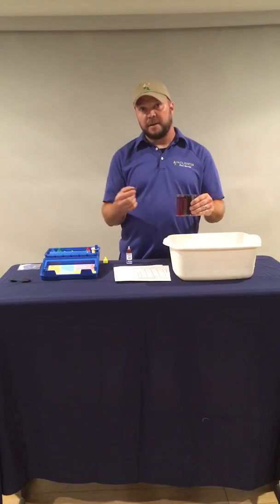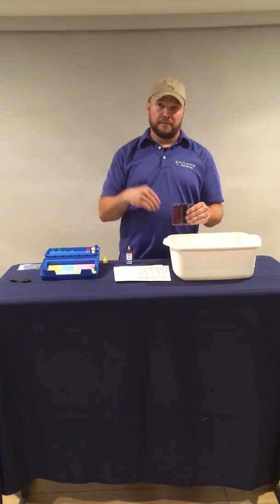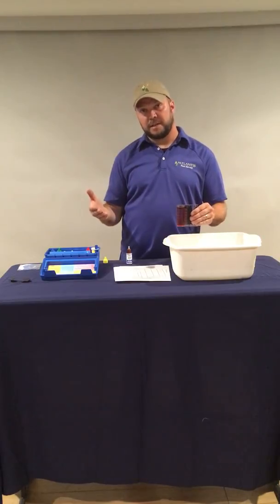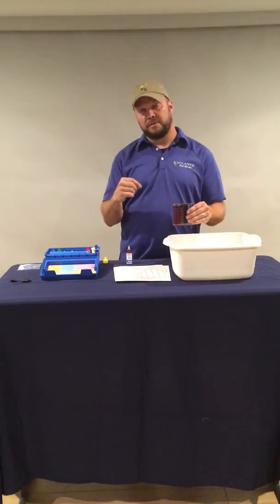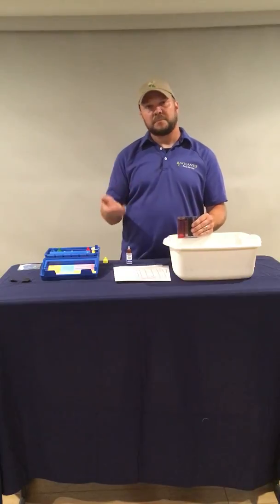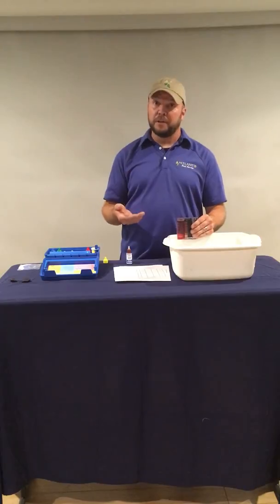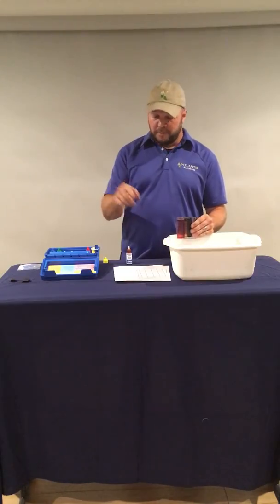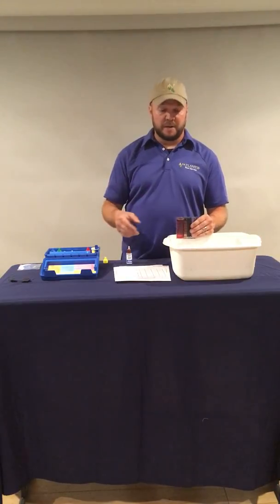And when I say turn clear, I don't mean start to turn clear and then go back to sort of pink, fully turn clear. When it fully turns clear, that's when you're done with your testing and you can multiply the number of drops you added by 0.2 to get your actual reading. So let's say that we had done this, we added 20 drops times the 0.2, that gives us a free chlorine reading of 4.0 parts per million. So then we record that on our sheet for the pool or for the hot tub, depending on which body of water we're testing.